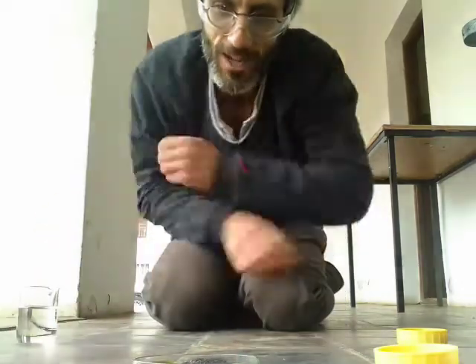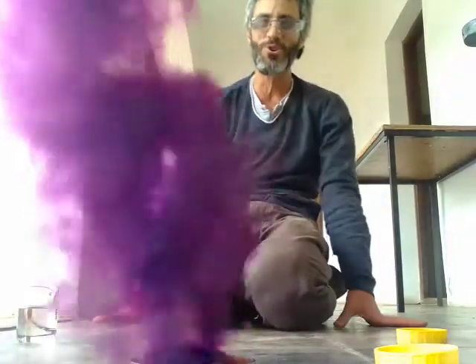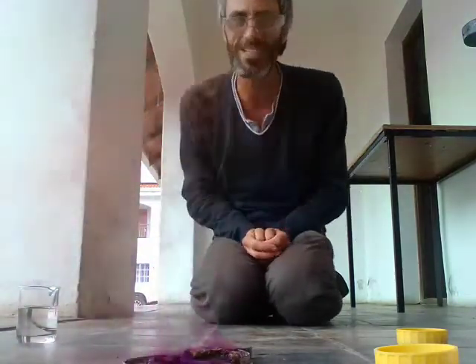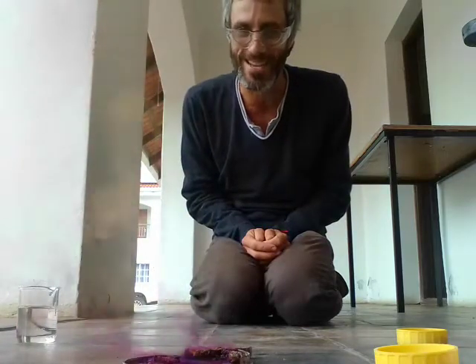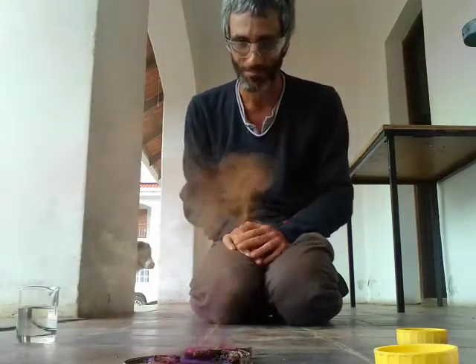And it does take a little while. Opa, and then you see this beautiful purple smoke. Actually, that's really cool. Now, I've done it outside, and you can see I'm stepping out because, woo! Did you see that? It just broke. That was amazing. That never happened before. How cool is that? Okay, let me try and explain what happened.